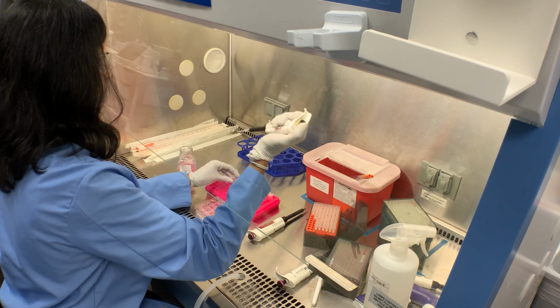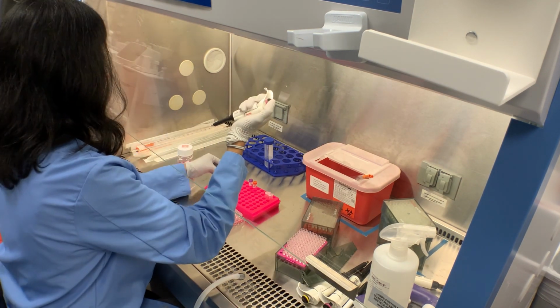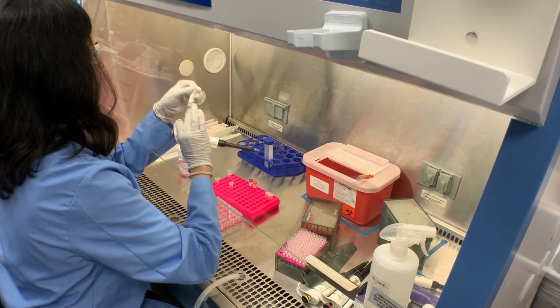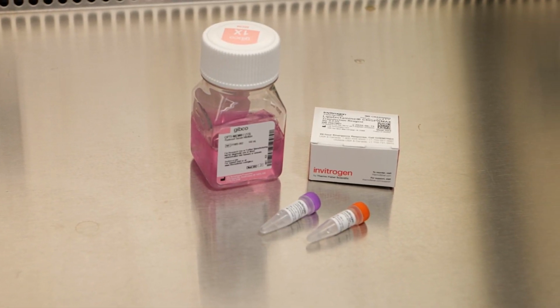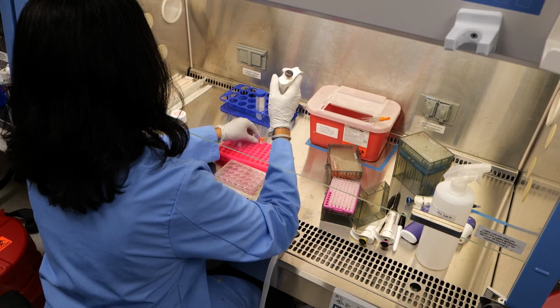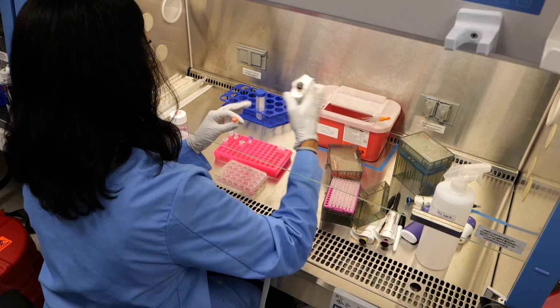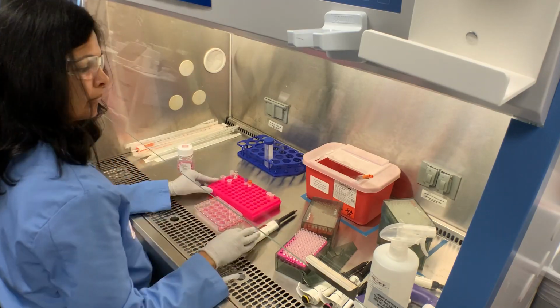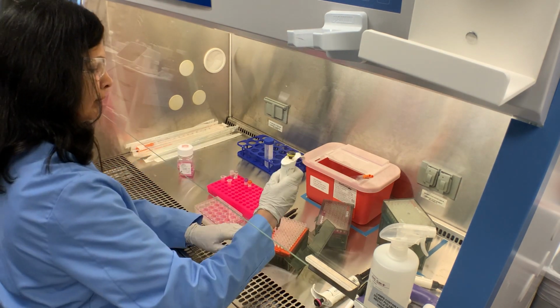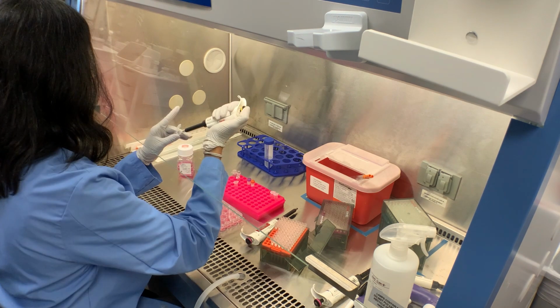For each gRNA, prepare 1 RNase-free microcentrifuge tube with gRNA, TrueCut Cas9 protein, Cas9 Plus reagent, TrueTag donor DNA, and OptiMem medium. We recommend mixing Cas9 protein and gRNA at a 1:1 ratio and make sure to add the Cas9 Plus reagent to the tube last. Set these tubes aside at room temperature while you prepare a second corresponding tube for each gRNA.